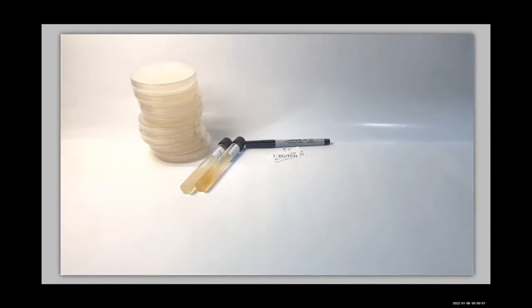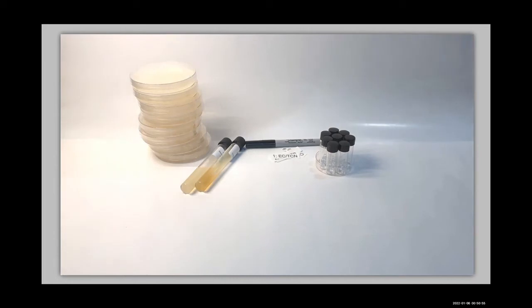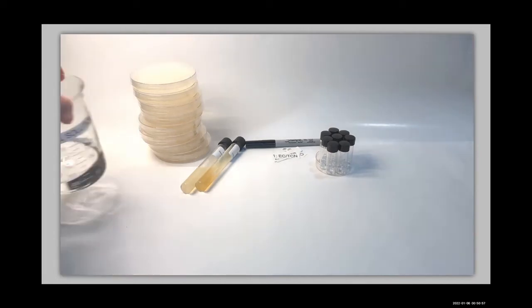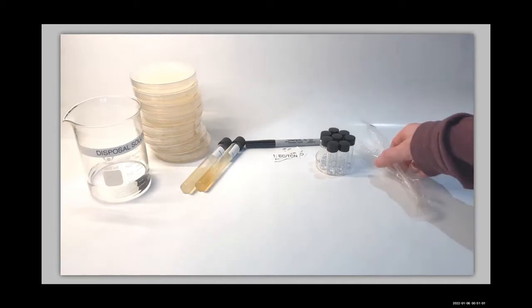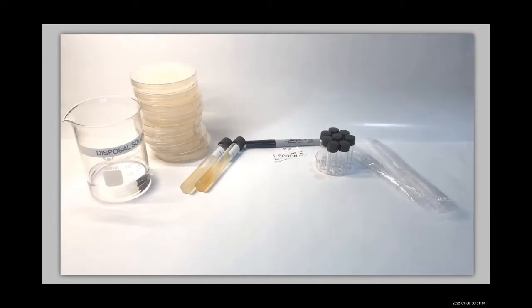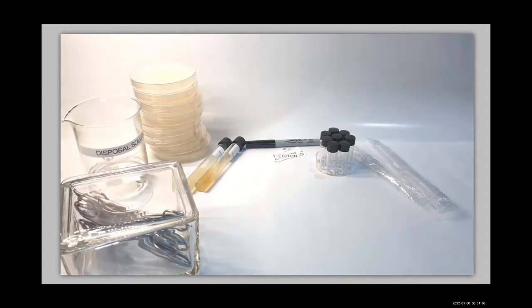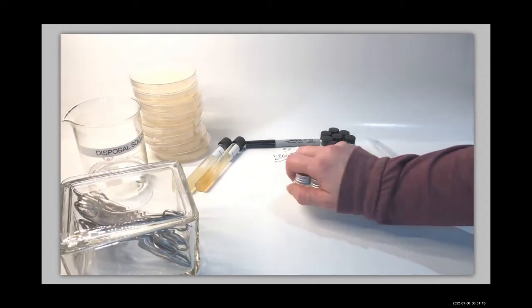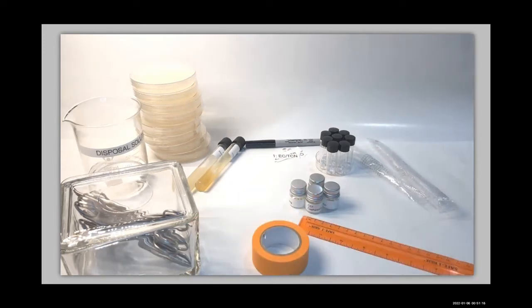32 sterile glass beads, disposal solution, 2 sterile micropipettes, 8 forceps. These have been sterilized using heat. 8 paper discs, 2 tetracycline, which we will denote TCN, 2 clindamycin, which we will denote CLI, 2 cephalexin, CEF, and distilled water H2O, masking tape, metric ruler, and incubator.